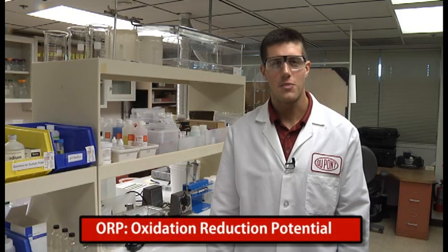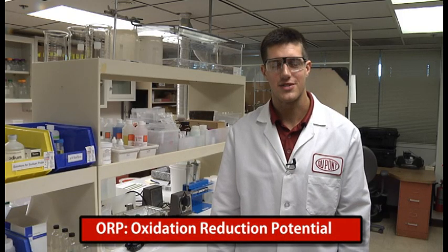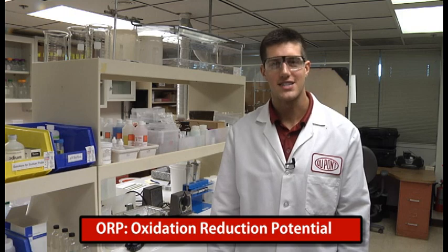We're going to do this using an ORP method. ORP stands for oxidation reduction potential, and it's the relative measure of any oxidative or reductive species in our water.